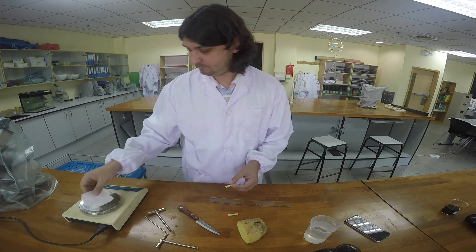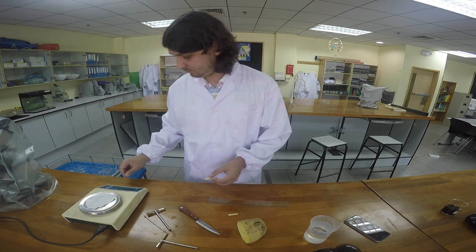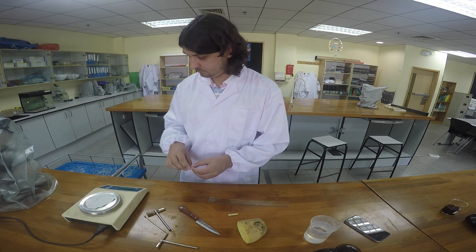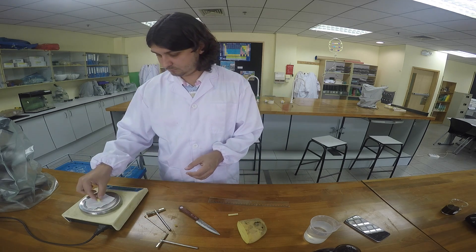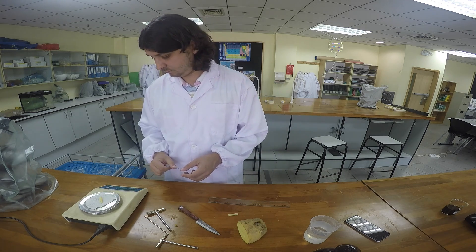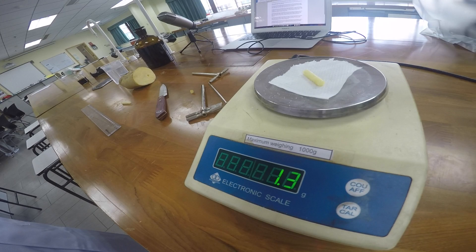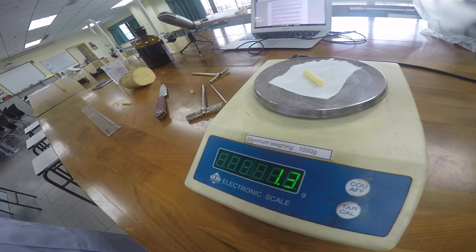Use a weighing boat or a piece of paper and mass your potato cylinder and record it into your data table. Remember to tare the scale prior to doing this.